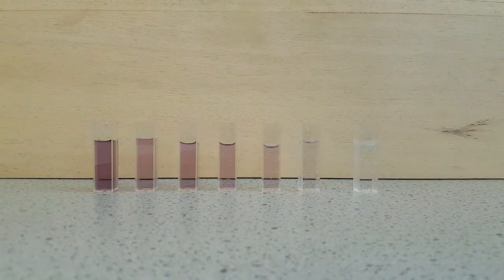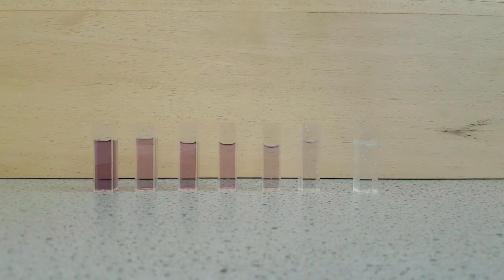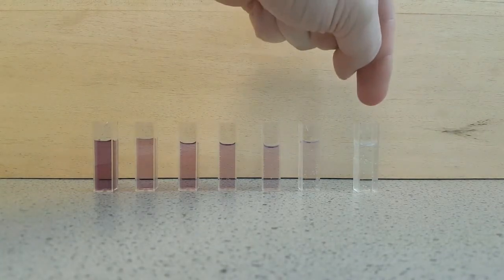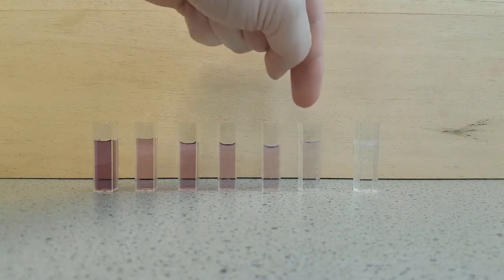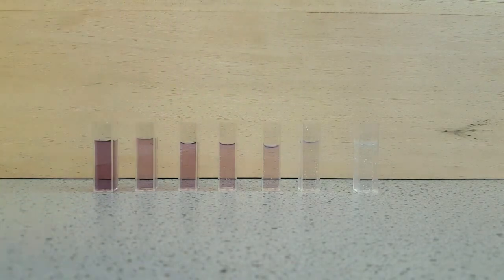Now we need to run a reference sample before analyzing any other samples on our colorimeter. For that we'll use our reference here, and then we'll go from the weakest all the way to the most concentrated standard.